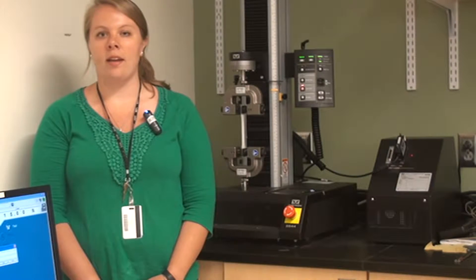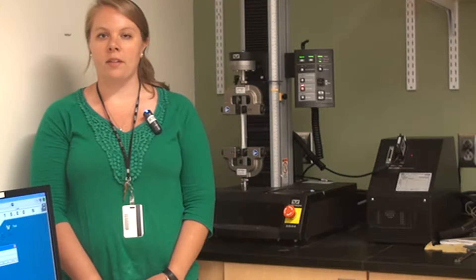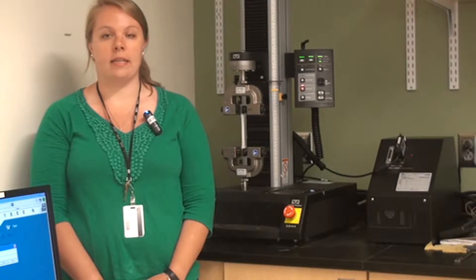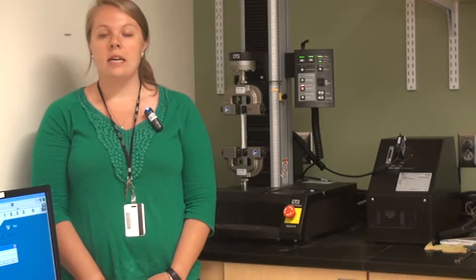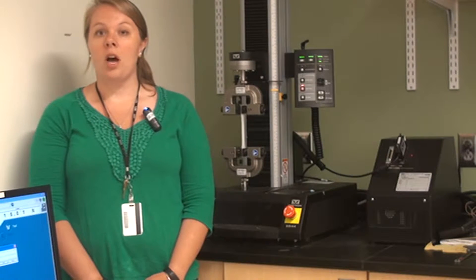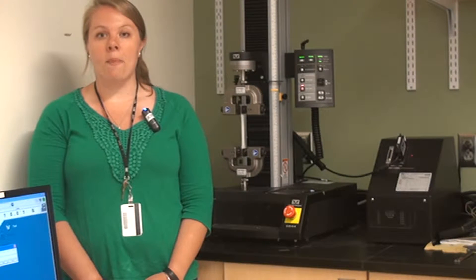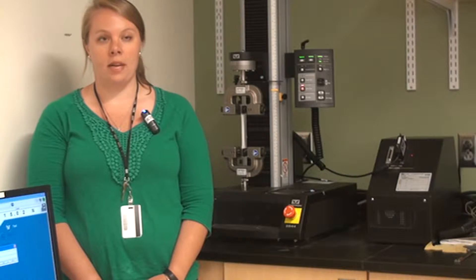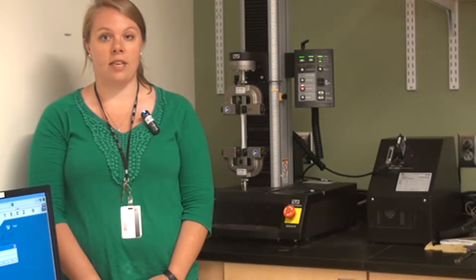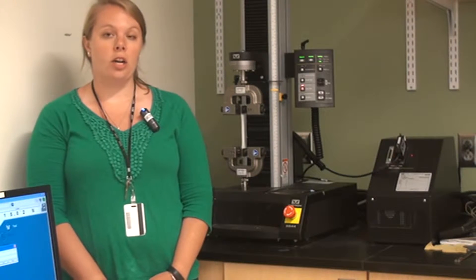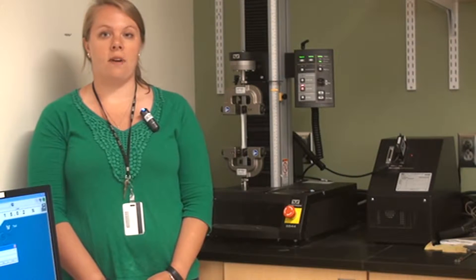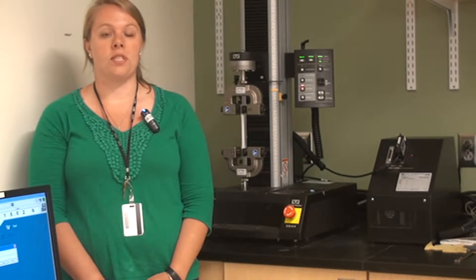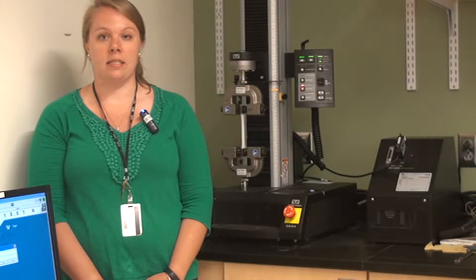Hi, my name is Jen and I'm from the Biomedical Engineering Department at Worcester Polytechnic Institute. Today I'm going to show you a tutorial on how to make measurements on a rectangular sample for tensile testing on our Instron 5544 materials testing system.